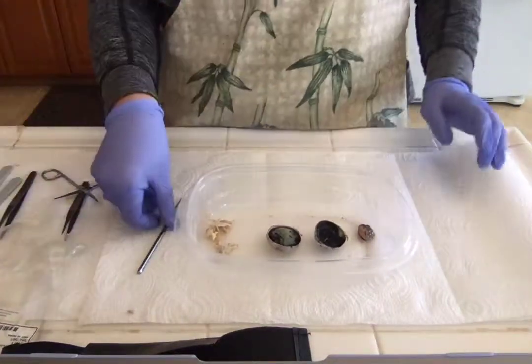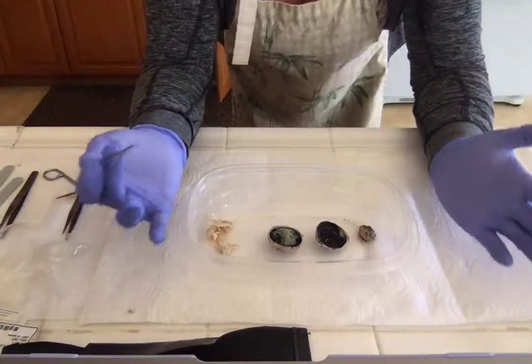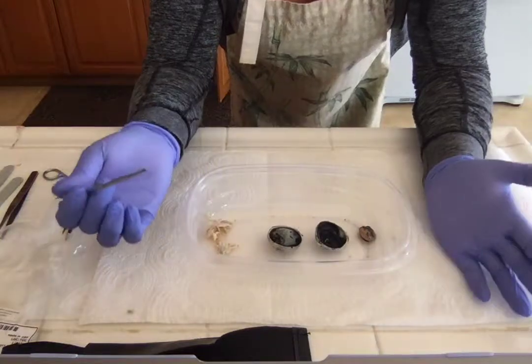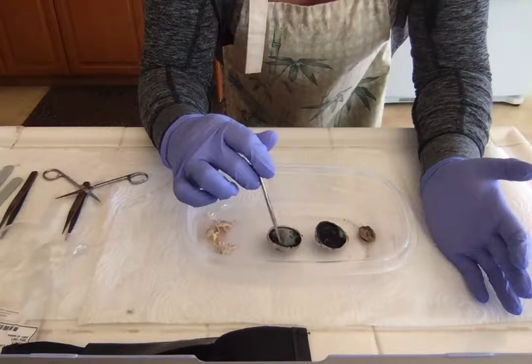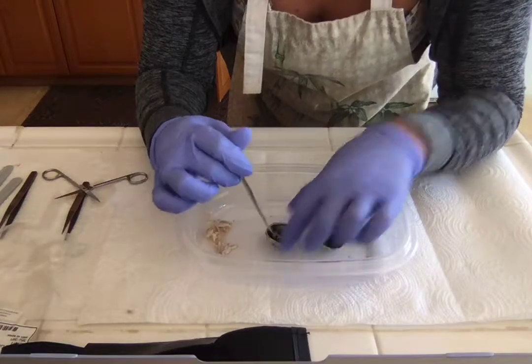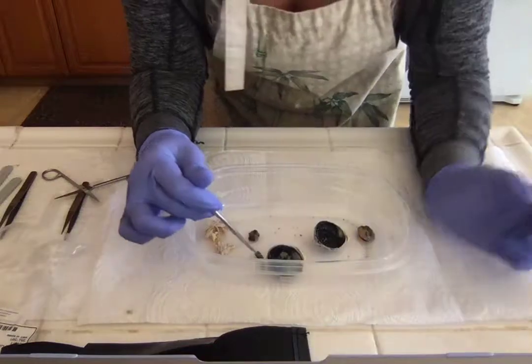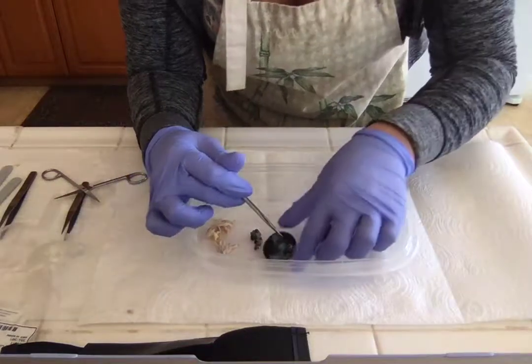I think one of the things that I learned the most is that the retina isn't actually the lens, which most people confuse it as. It's actually that whitish, milky kind of substance that is found inside the posterior eye, which mine was kind of bunched up when I first opened it.